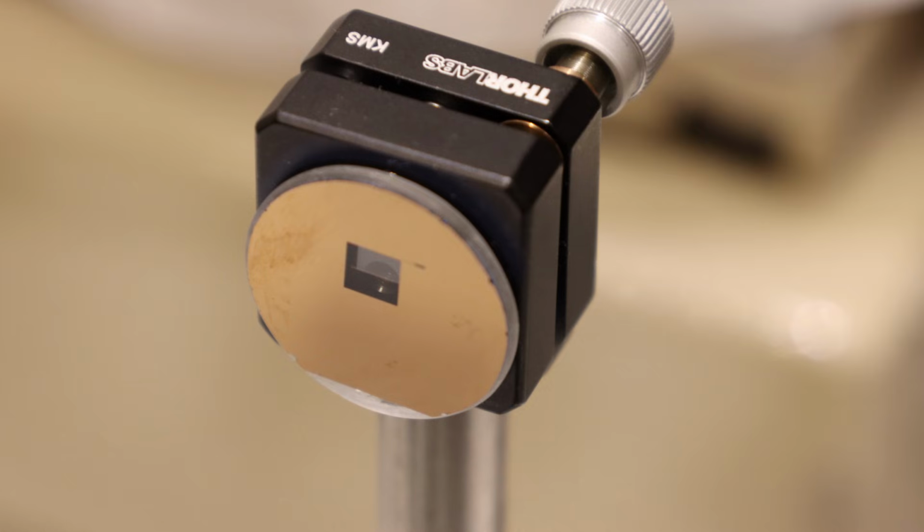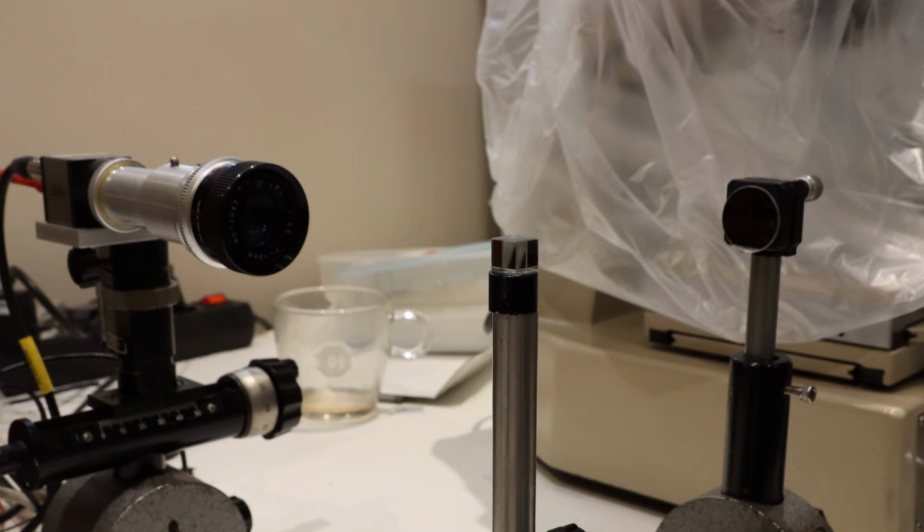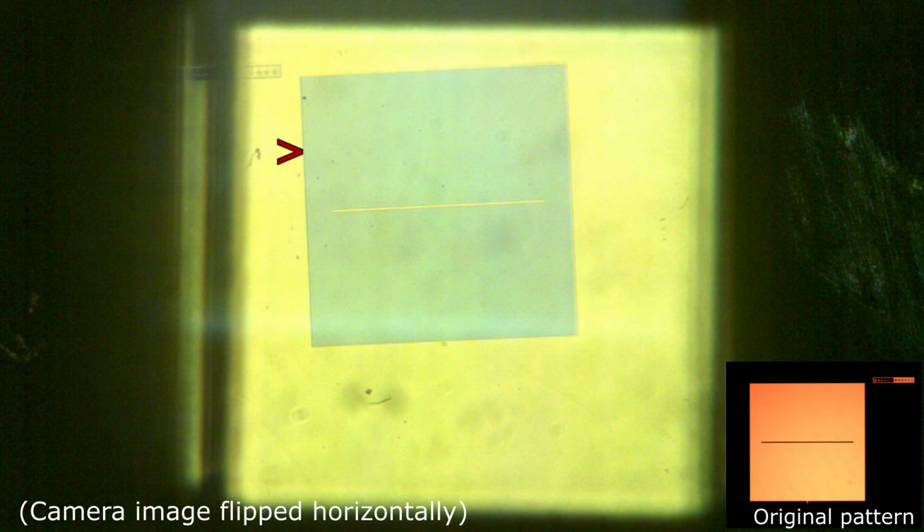The sample and the reference mirror were taped to adjustable mirror mounts and then aligned such that the reflected beams were projected on the camera sensor. And here you see what that looks like in the image recorded by the camera. In the image we can recognize the beam splitter area, which is about 10 by 10 mm square. It shows the reflected light from the sample and the reference mirror together. And what you see inside this area is the 5 by 5 mm square area etched in the chromium. Here you can just make out the line in the center and a part of the tiny test structures.